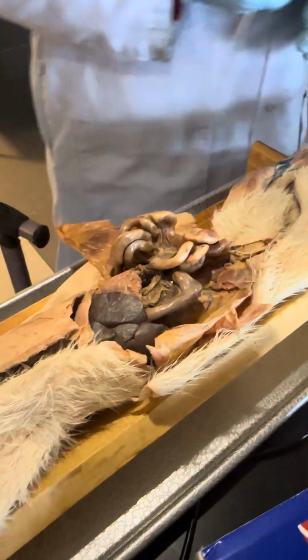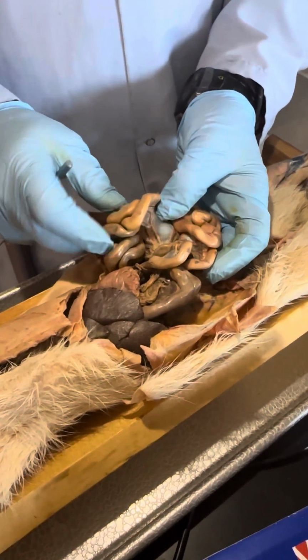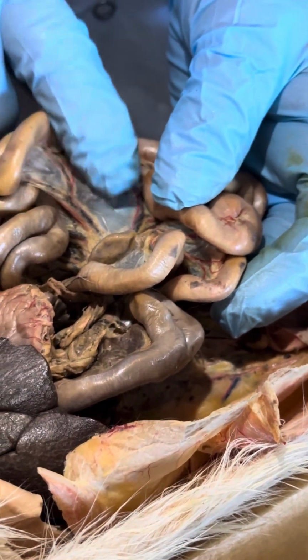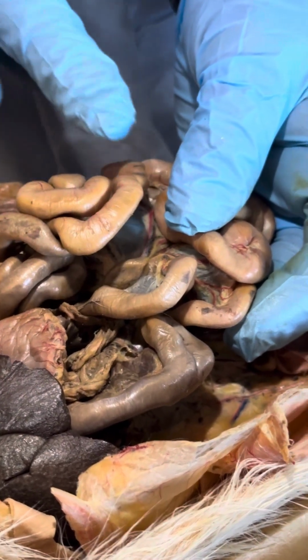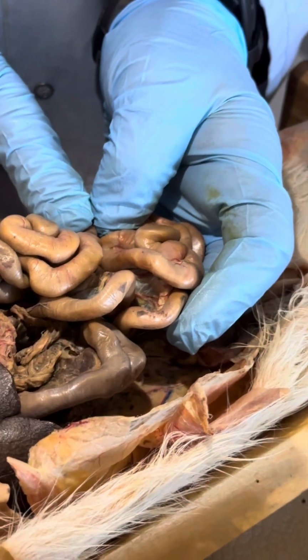There we go. Okay. So what's this called that goes out to the small intestine and back? Mesentery or mesenteric ligament. So we may not have talked about that, but this is incredibly important. It doesn't look like much, but it keeps your intestines from tying themselves in knots. And if they were to tie themselves in knots, you would die. And it would probably be a fairly unpleasant death.